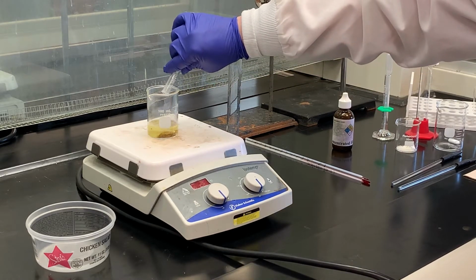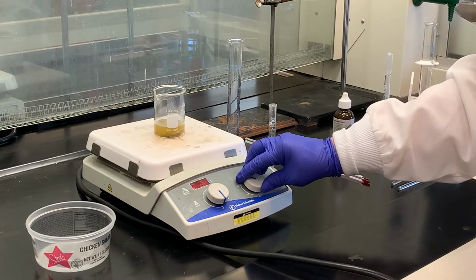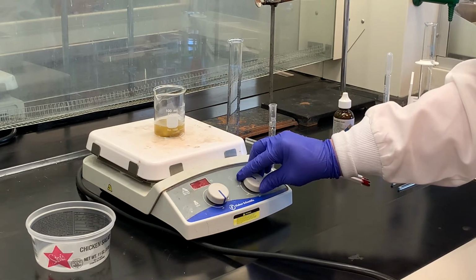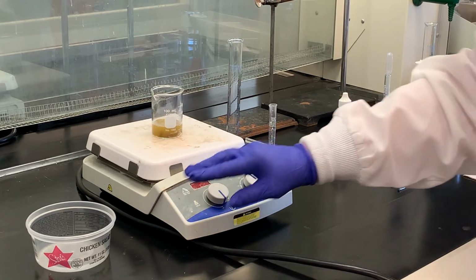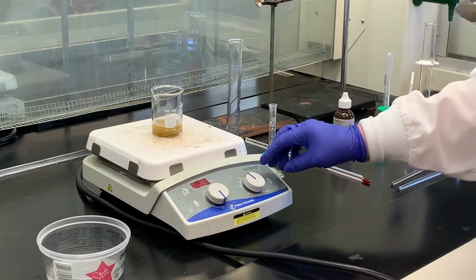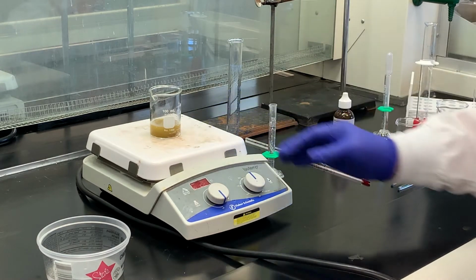Usually the amount of hydrochloric acid we add in diazonium salts is typically around maybe 2.5 times the amount of our diazo component that we're using. We just want to make sure that we have complete diazotization. So I'm going to stir this and try to get all that to dissolve. Once it's all dissolved, I'm going to use this as my container for my ice bath. I'll put that underneath there and then chill that down to 0 to 5 degrees. May take a few minutes.